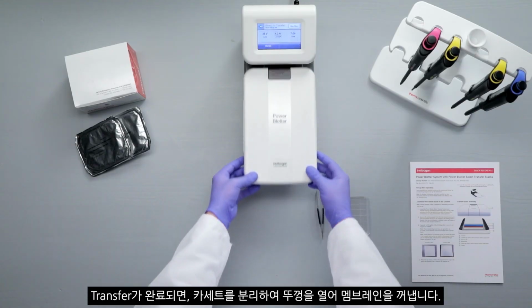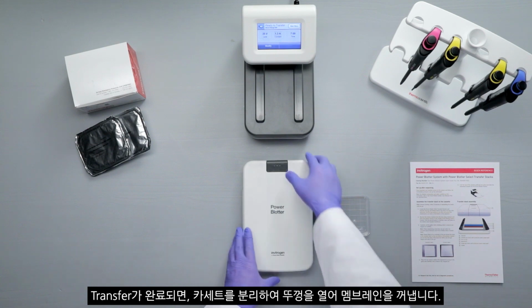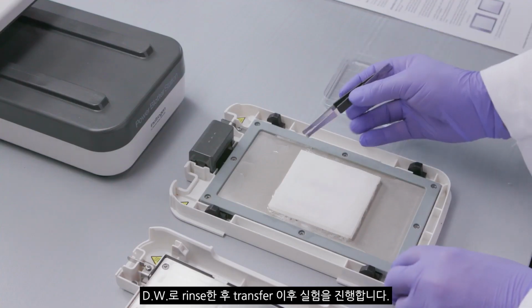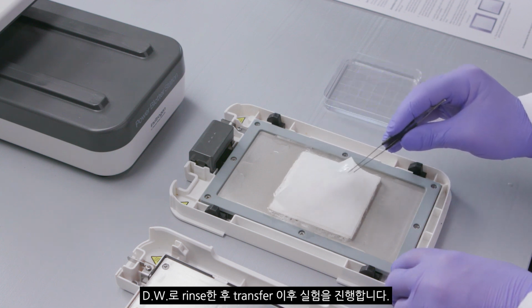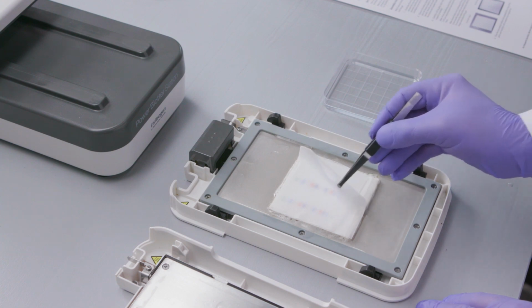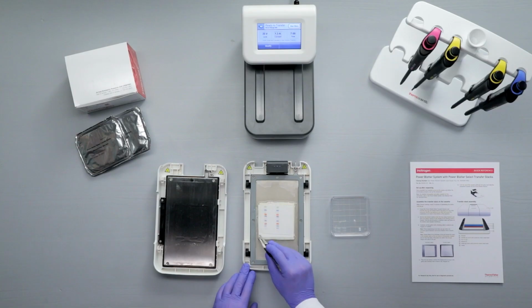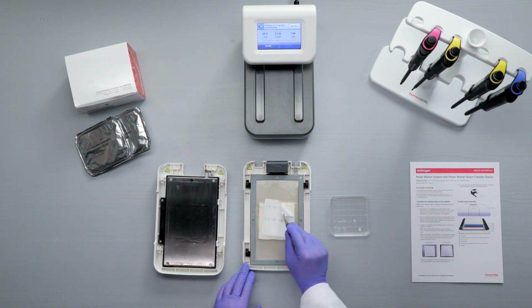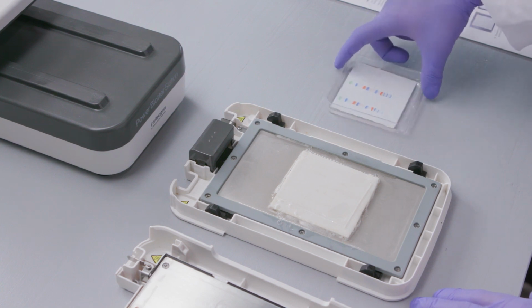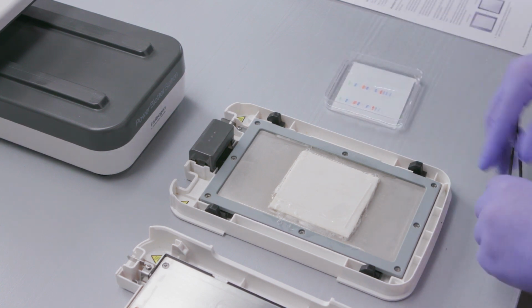Upon transfer completion, pull the cassette out of the base and open it. Carefully remove and discard the top stack and gel. Use forceps to remove the transfer membrane from the bottom stack. Membranes can rapidly dry out, so keep the membrane hydrated between each step in the procedure. Discard the bottom stack.